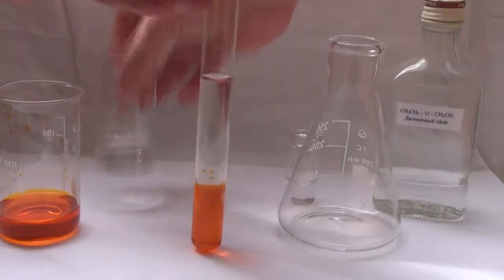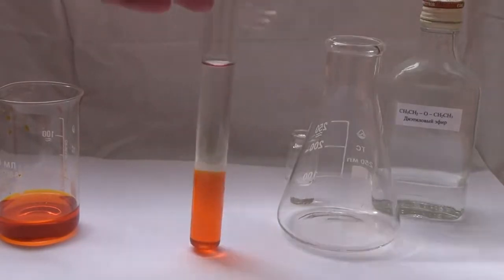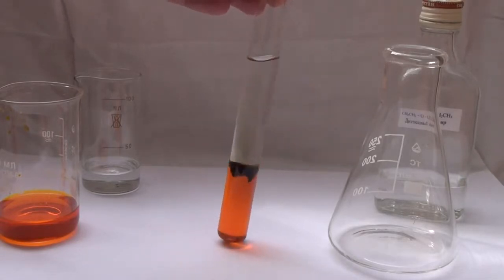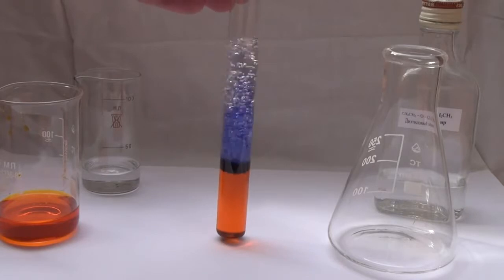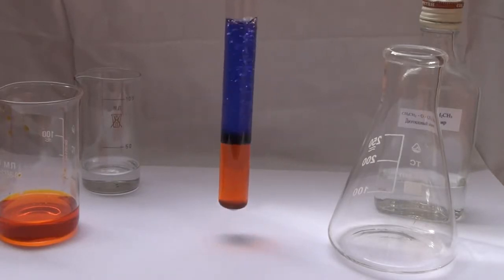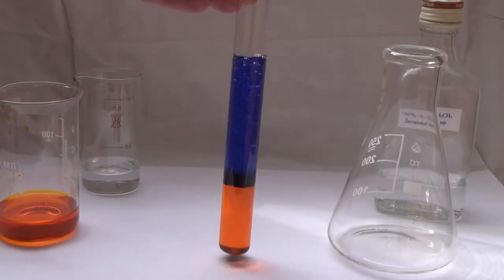Next, add a small amount of sulfuric acid solution to our mix. To start the reaction, add a few drops of 20% hydrogen peroxide into the test tube. After adding the hydrogen peroxide, a very interesting transformation occurs. The fluid between the layers of diethyl ether and potassium dichromate becomes dark.